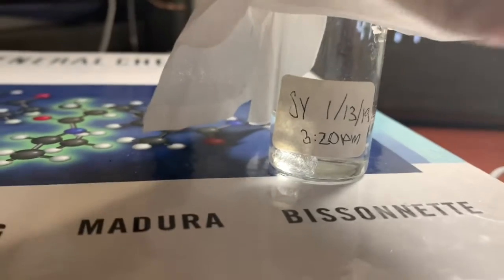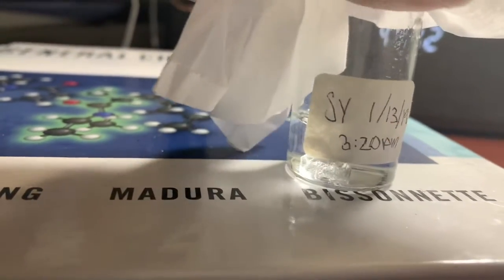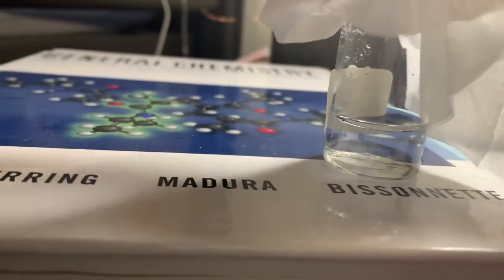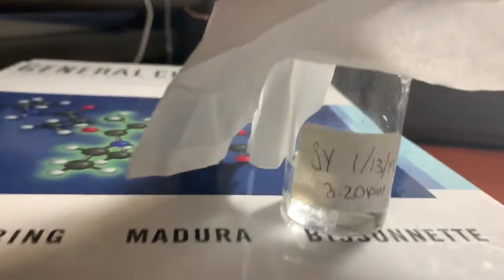Here's another look at my crystal. It is quite big. There's just one single chunk in there.